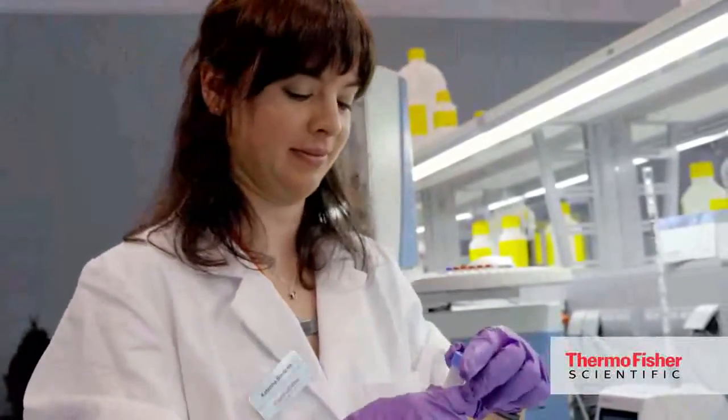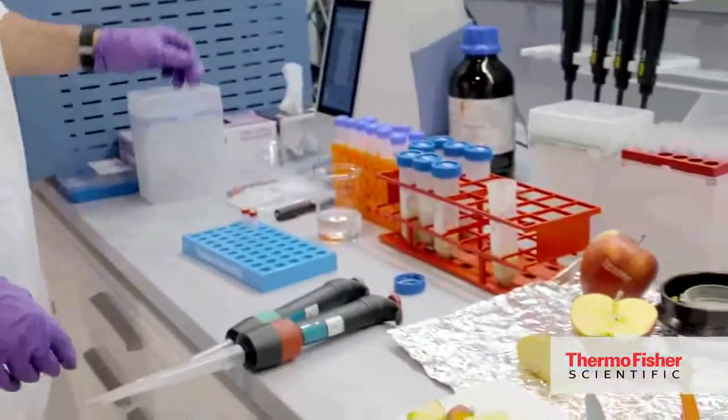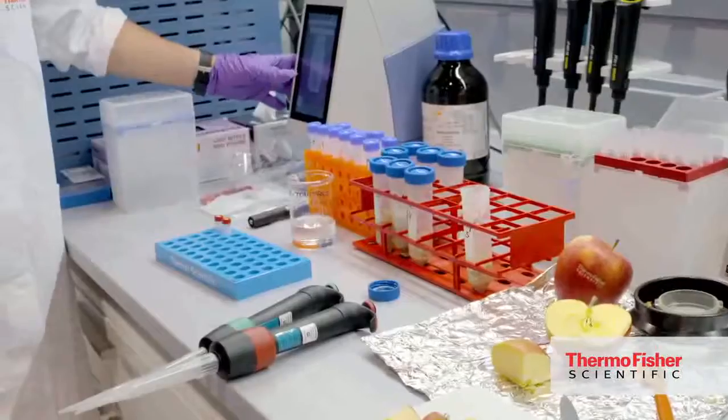After shaking time, about one minute, it can be put in the centrifuge. We centrifuge down. But again, the two phases will be separated.